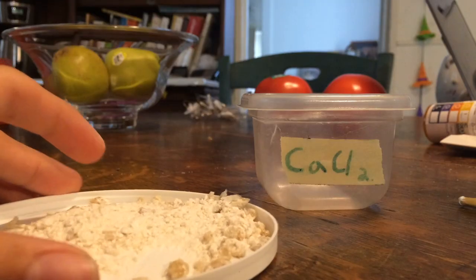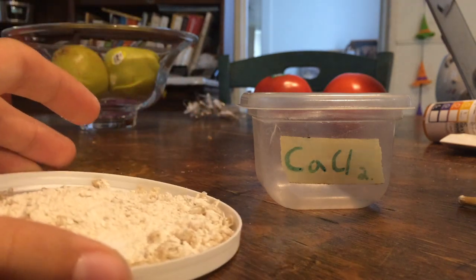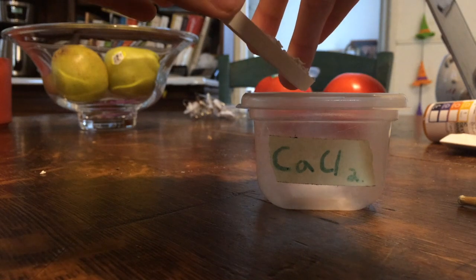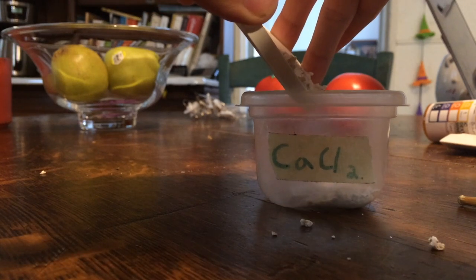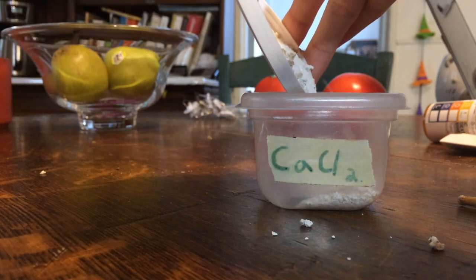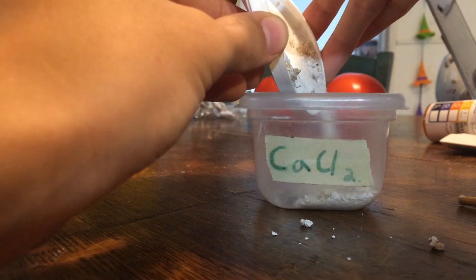Now that I've washed the calcium chloride once more to get it a bit more clean and dried, I'm gonna go ahead and add it to this container where I can use it for things in the future. I probably should be using a funnel for this, but it does seem a bit too late for that.